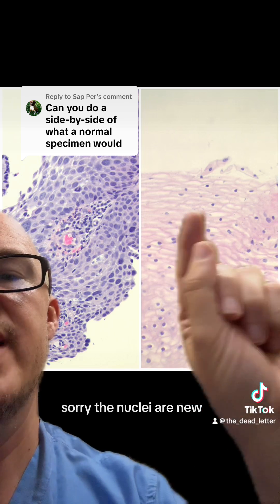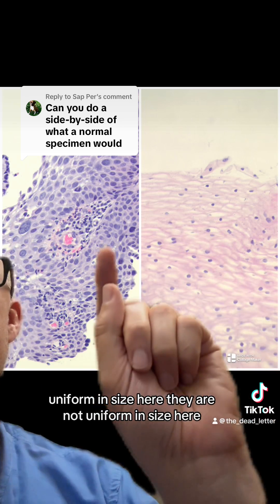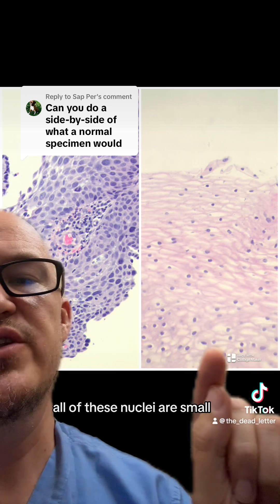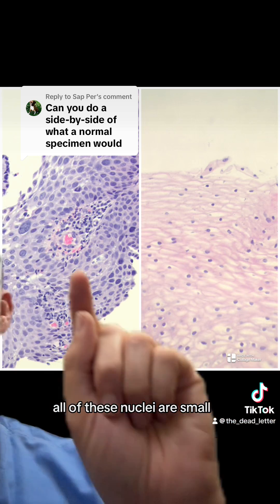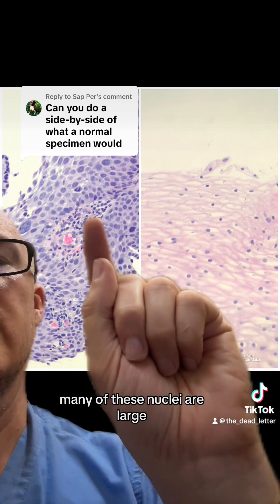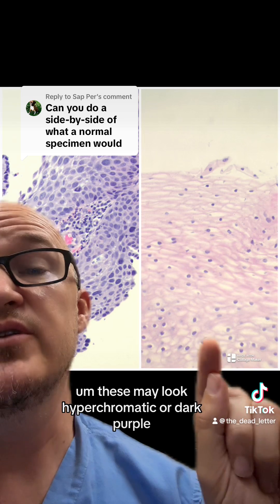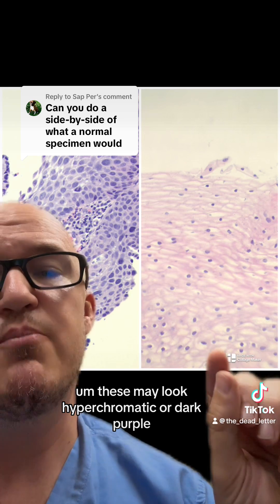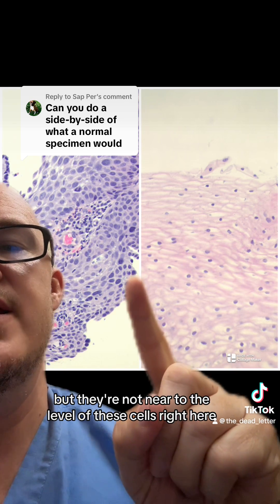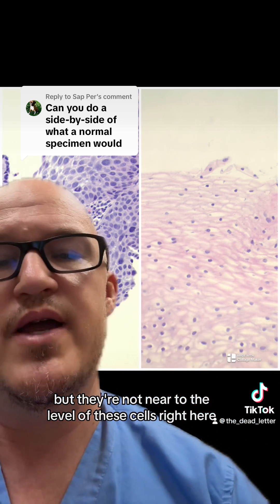The nuclei are uniform in size in the normal specimen, but they are not uniform in size in the abnormal one. All of these nuclei are small in the normal, while many of these nuclei are large in the abnormal. These may look hyperchromatic or dark purple but they're not near to the level of these cells right here.